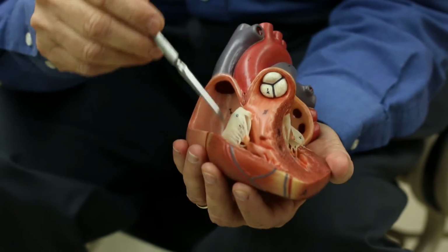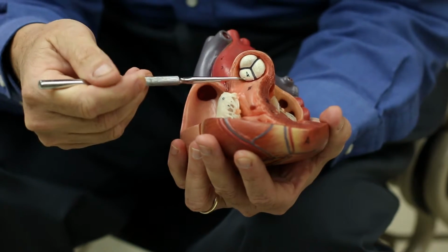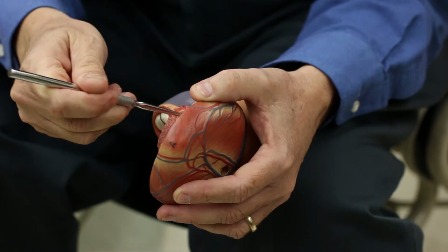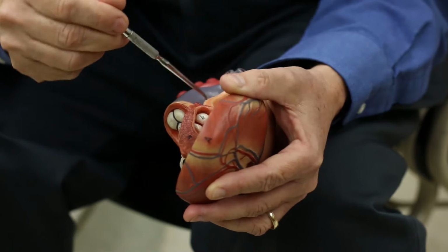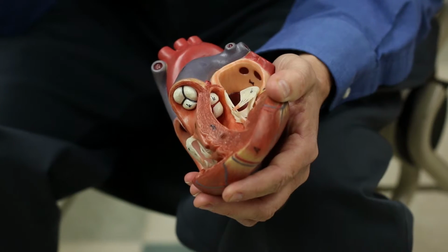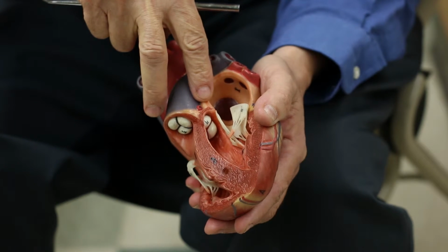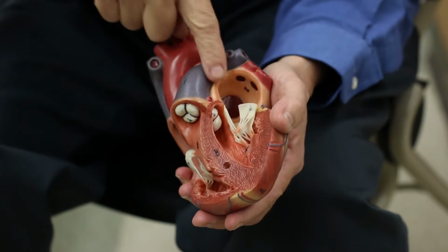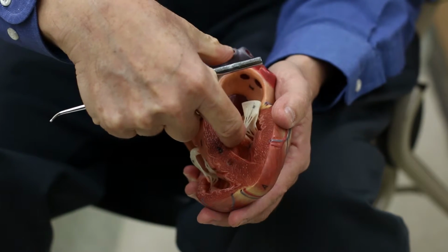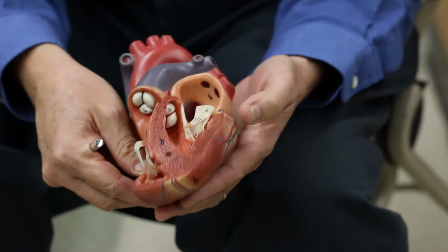Now, separating the ventricles, both the right and left, from the major blood vessel it's attached to, are these things called the semilunar valves. There's one here, and this one actually was used in a test and has a sticker on it, so we can remove that. And there's another one here. These do not need an extra muscle like the AV valves. They're just little flaps. These flaps move up against the wall of the blood vessel. When the ventricle relaxes, blood will start flowing backwards, but these flaps fill up with blood and spread out and block the entrance back into the heart. So they keep backflow from going back into the heart. And those are your semilunar valves.